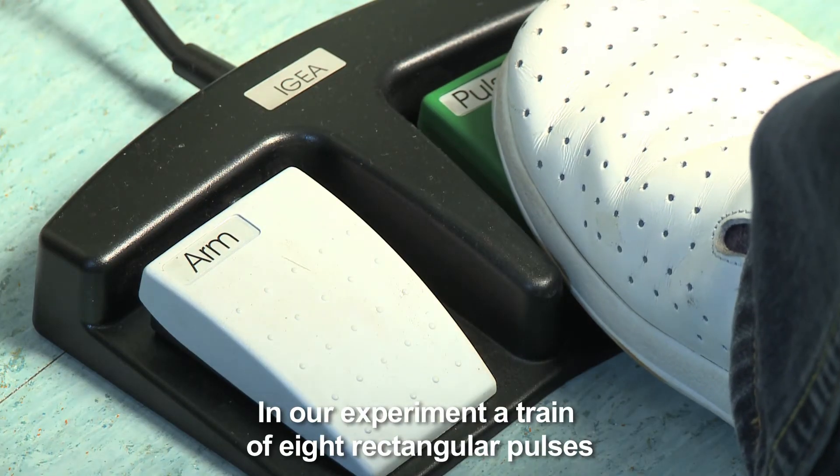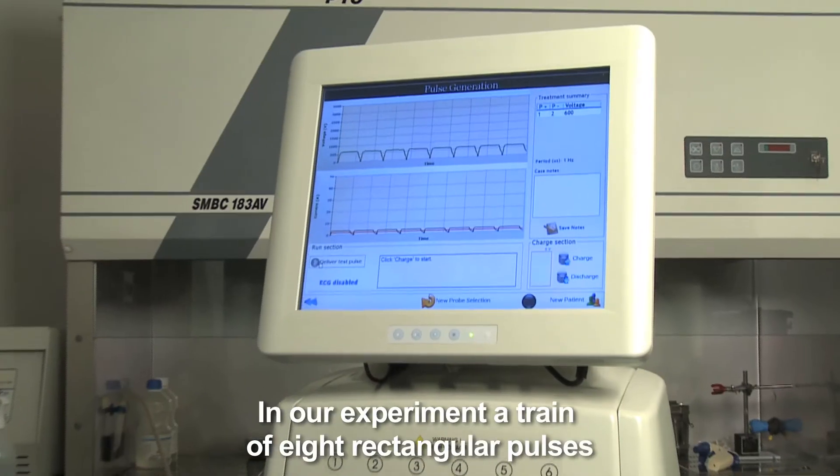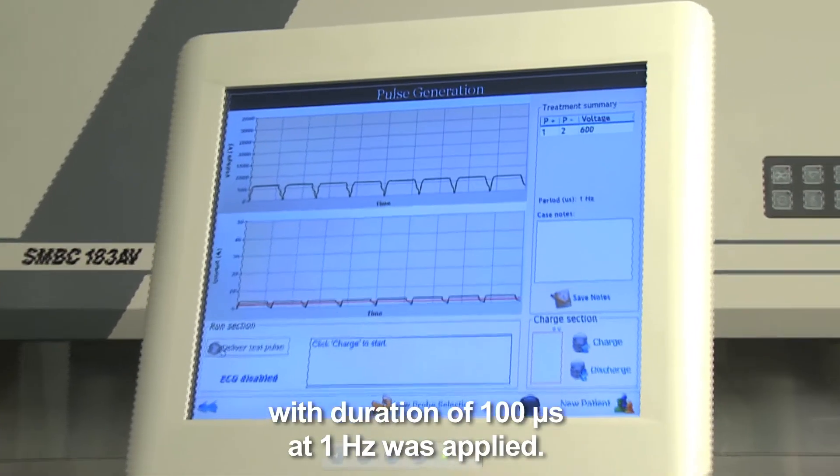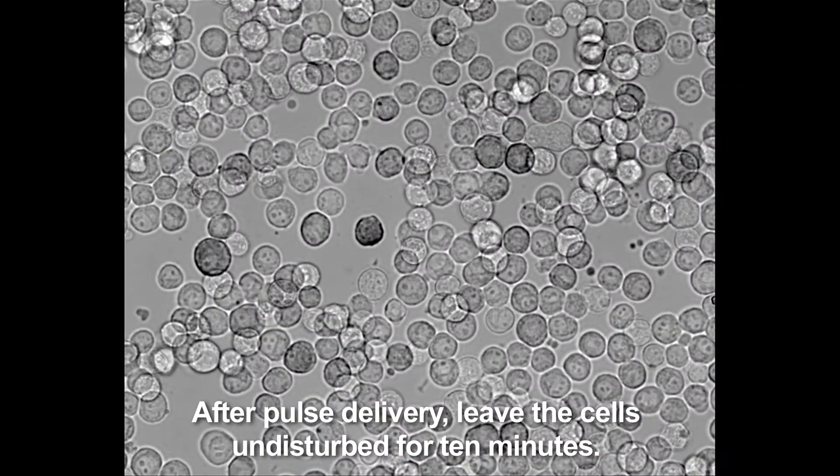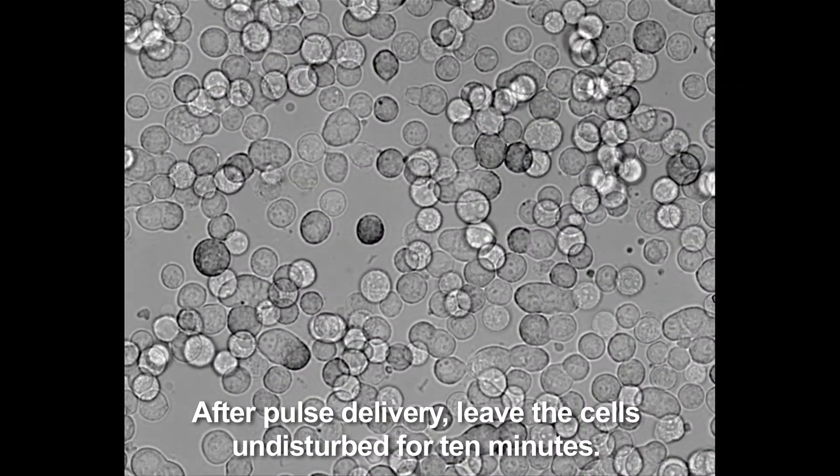In our experiment, a train of 8 rectangular pulses with duration of 100 microseconds at 1 Hz was applied. After pulse delivery, leave the cells undisturbed for 10 minutes.